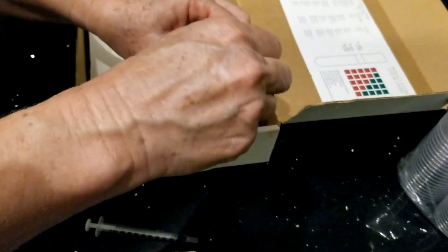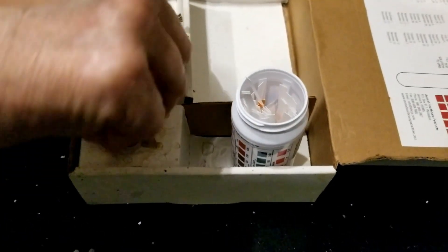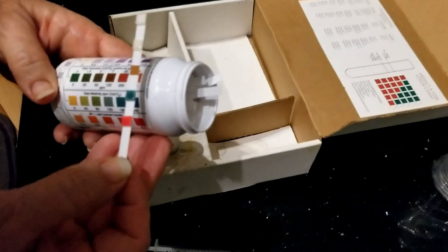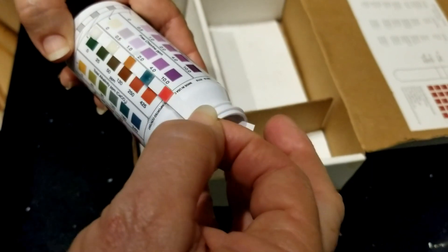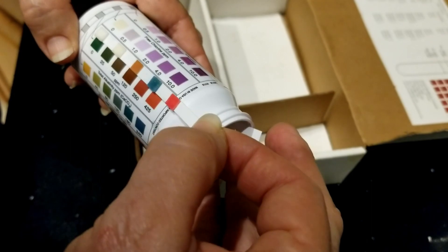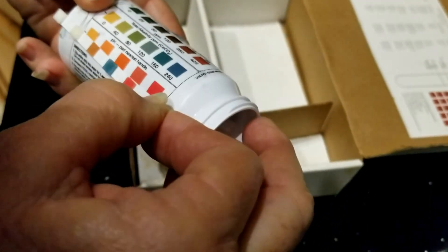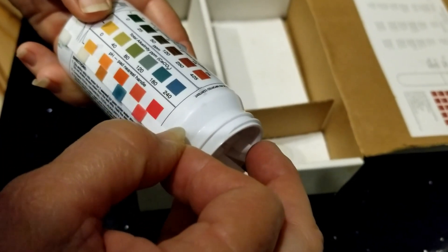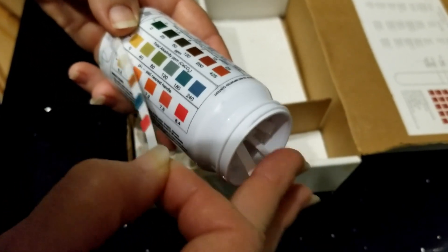New test strip — dunk. Then again compare; it is the same thing, we are going by the third one and check across. She looks like she is probably in between. Then pH — she is a little lighter, she is in between. pH is starting to drop, but not much. So definitely not tonight. We will test her again tomorrow.